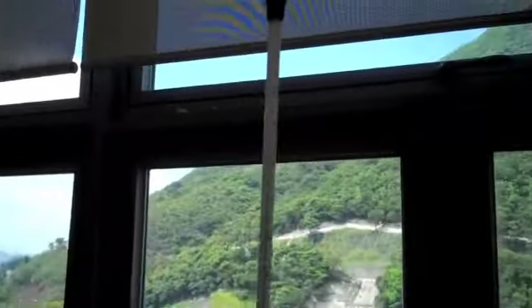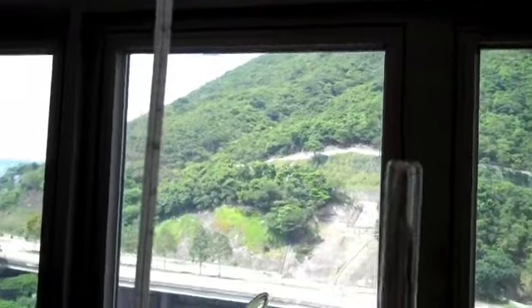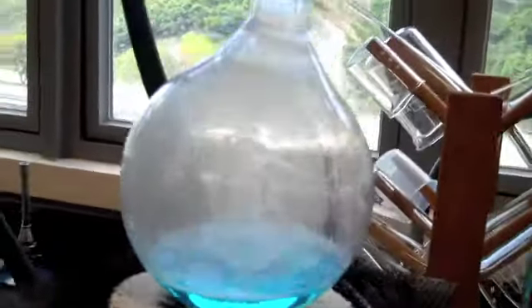When the temperature on the thermometer moves up from 82 degrees, it means that the presence of the alcohol is now gone in the distillation flask and has moved to the receiving flask. After measuring the distillate, we found there to be 73.7 milliliters of isopropyl alcohol. This process was then repeated 3 other times with the other substances.